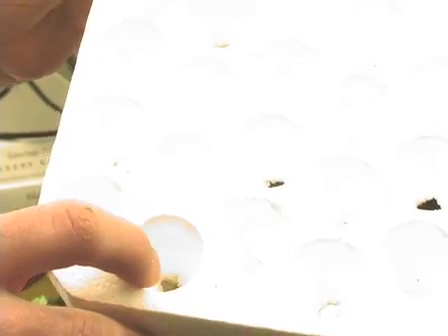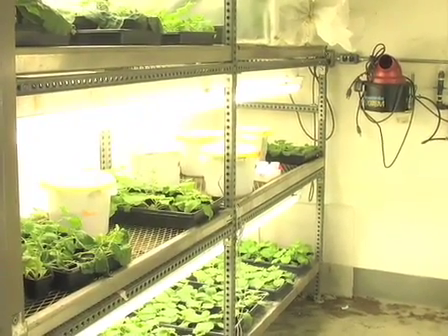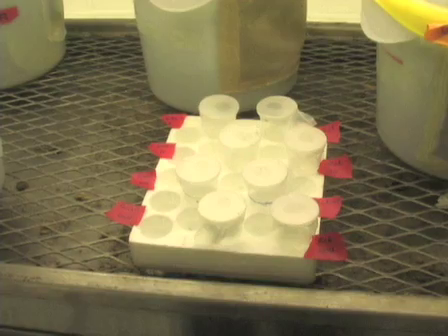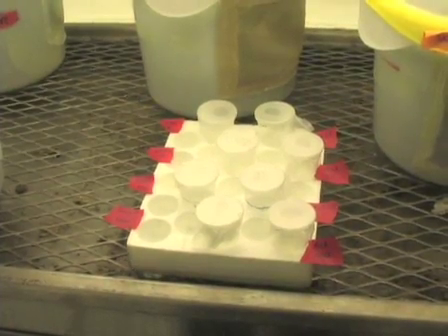And I'll put this cup in this tube holder and place it on a rack in the insect room under a long day photoperiod, under lights.